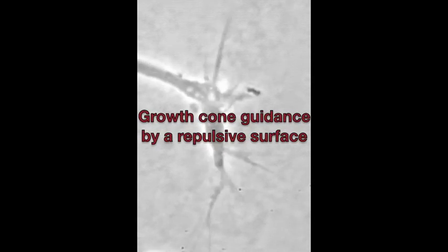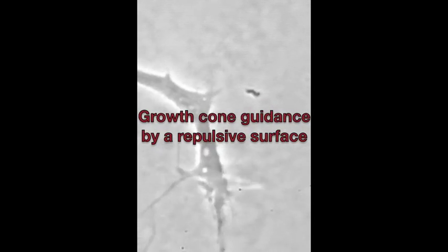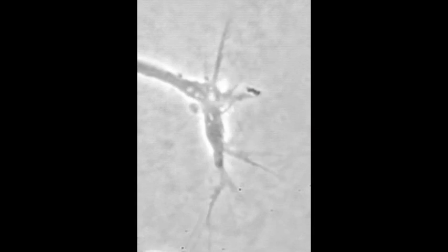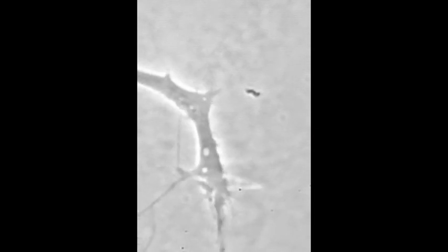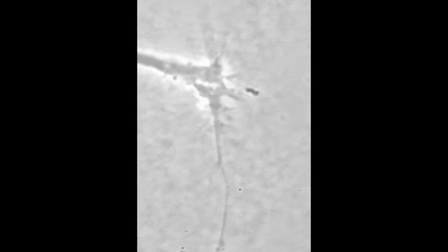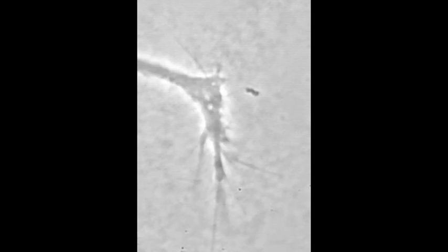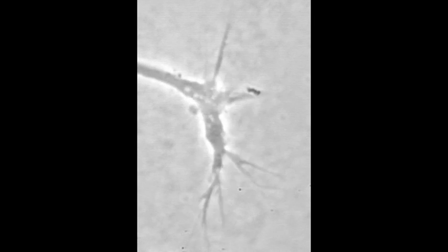In this movie, a sensory neuronal growth cone turns at a boundary between laminin and laminin mixed with chondroitin sulfate proteoglycan, called CSPG. Growth cone filopodia probe ahead, but the growth cone stalls at the border.